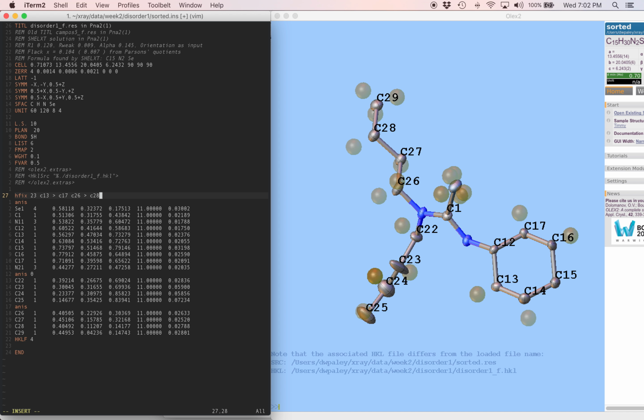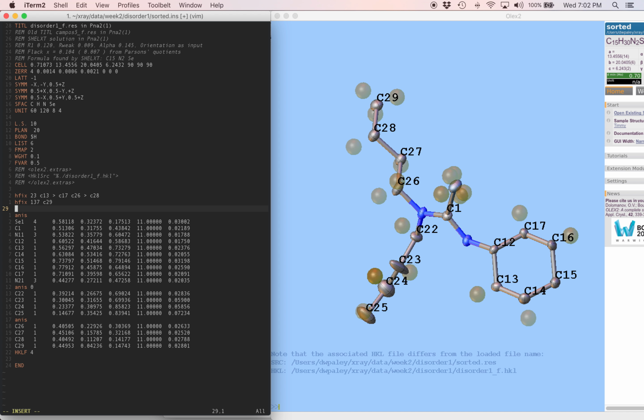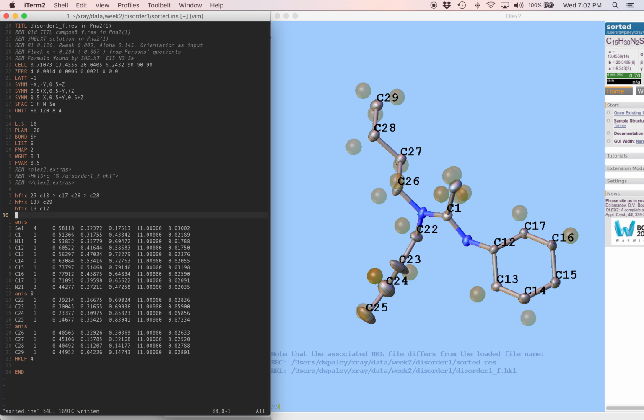And we already decided we're going to leave hydrogen atoms out of our disordered part until we get a little farther along building that disordered model. We have one methyl group not in the disordered part, which is C29. And finally, we have methine CH C12, and that's hfix 1,3. Okay, let's run this refinement.